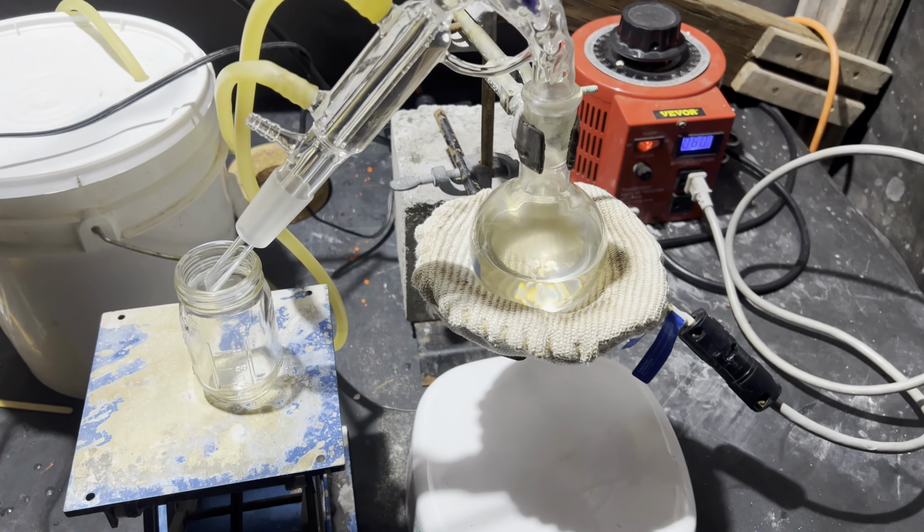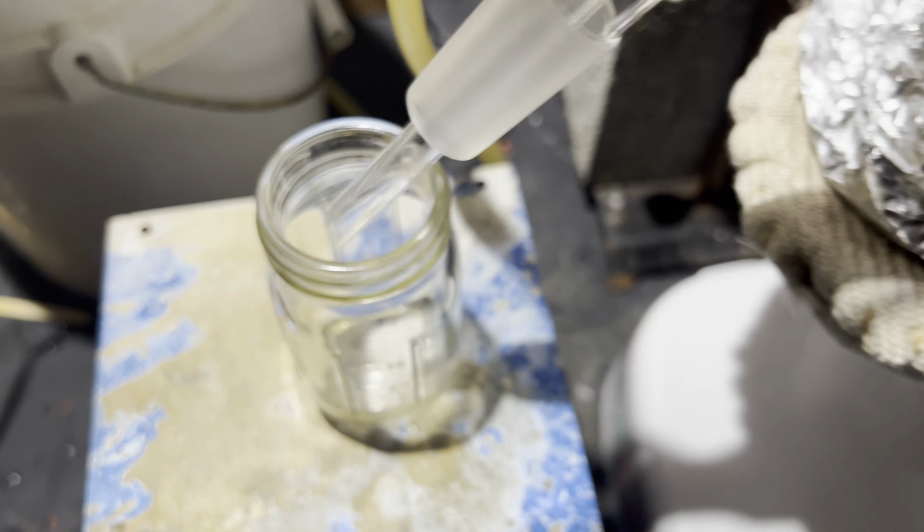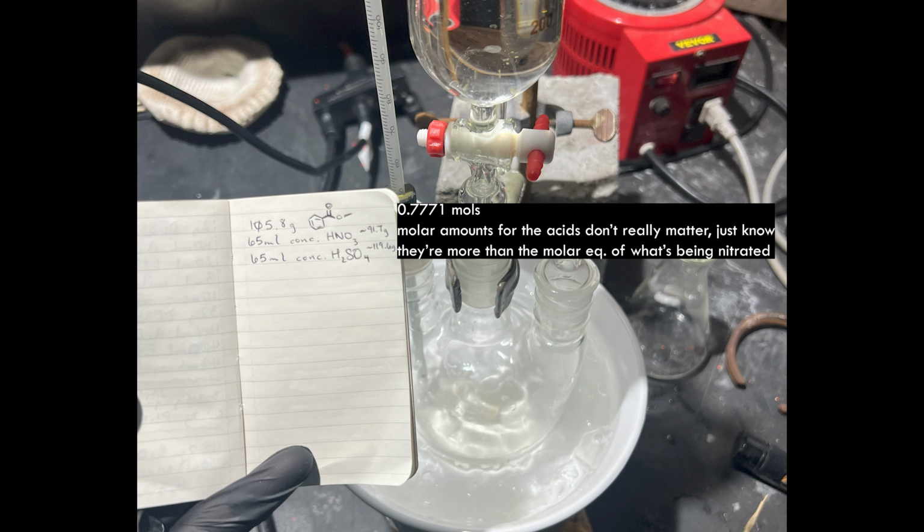The literature yield was 92%, and I even refluxed it for twice as long as it said to get a higher yield, but mine was still lower for some reason. Now, time to nitrate the ester. I completely messed this up the first 2 times because of something that's mostly not my fault.